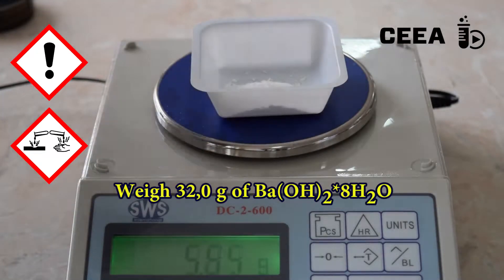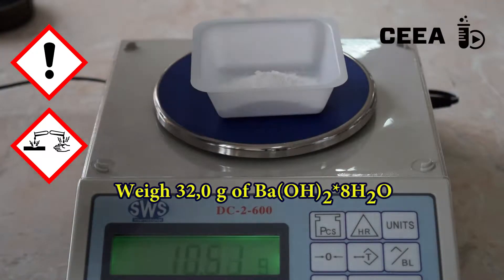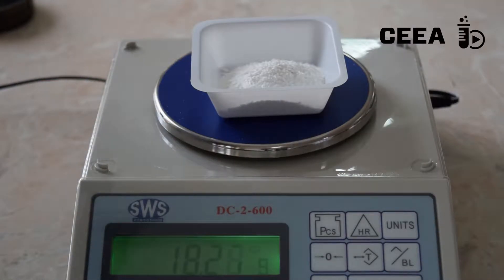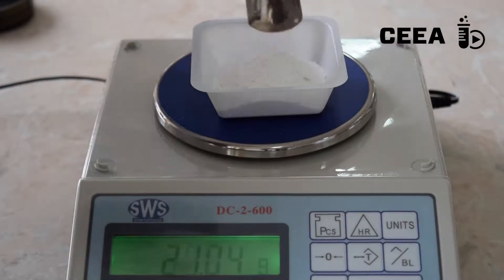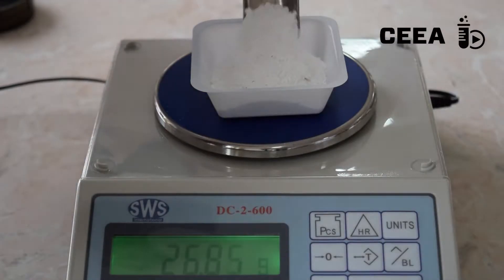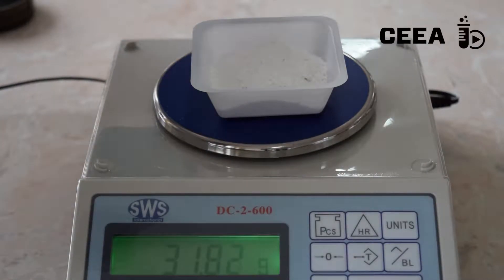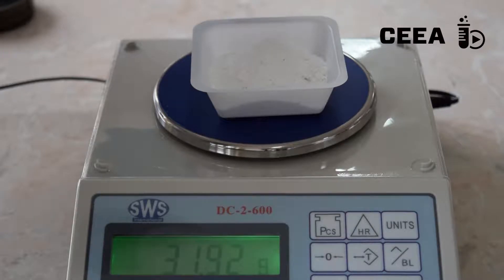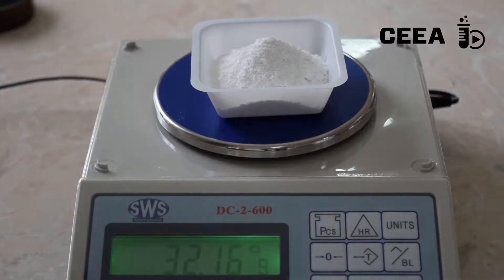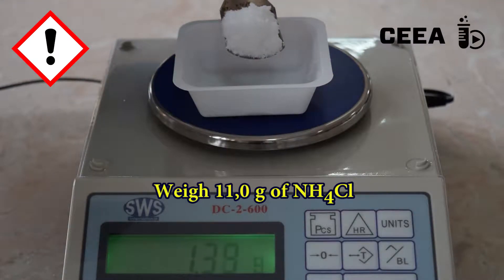For this we need 32 g of barium hydroxide octahydrate. We also need 11 g of ammonium chloride.